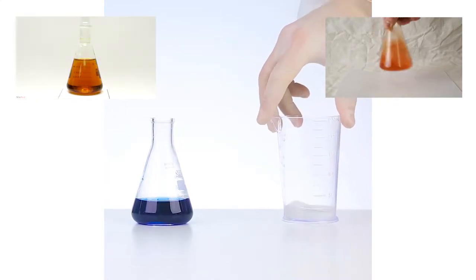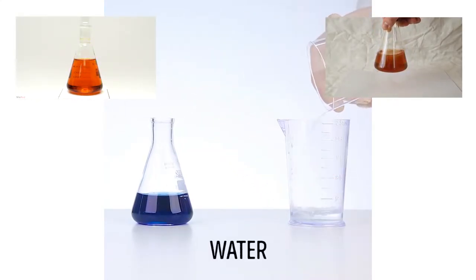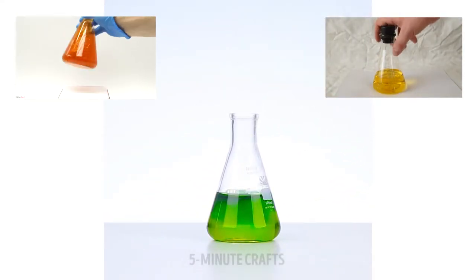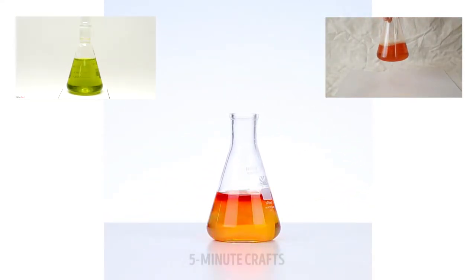Just some basic sugar water, sodium hydroxide, and indigo carmine will enable you to go from yellow to red to green and back again, which got us to thinking.